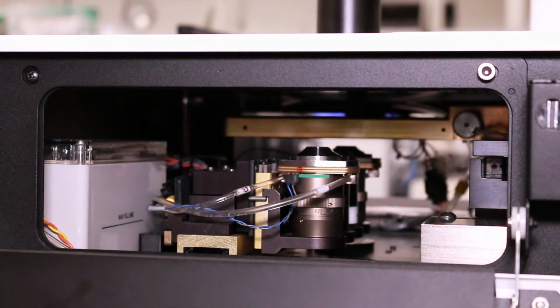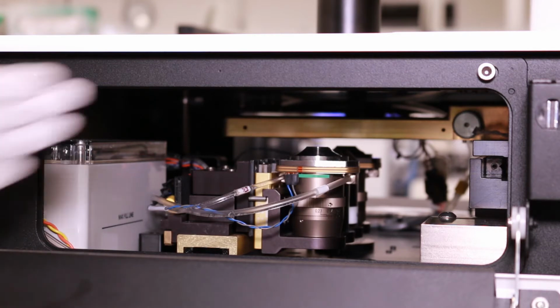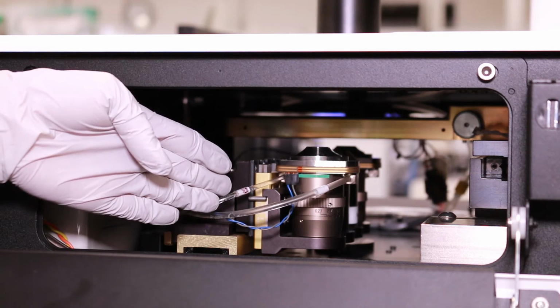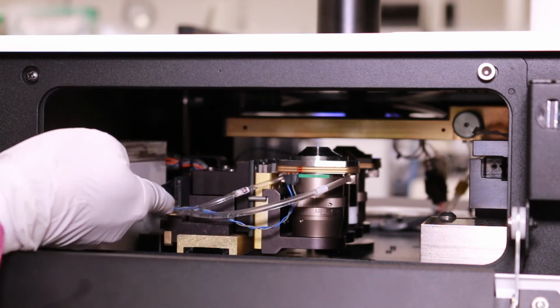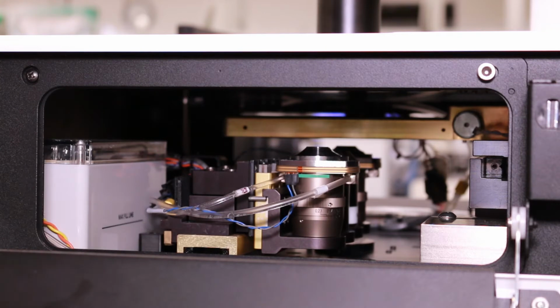The interior of the ImageXpress Micro Confocal system has a linear slider that holds 4 objectives. In this particular system, we have 2 water immersion objectives installed. Facing you is our 20x water immersion objective, as indicated by the tubing and wiring. In addition to 2 water immersion objectives, the linear slider can also host 2 additional air objectives that can be swapped in and out.